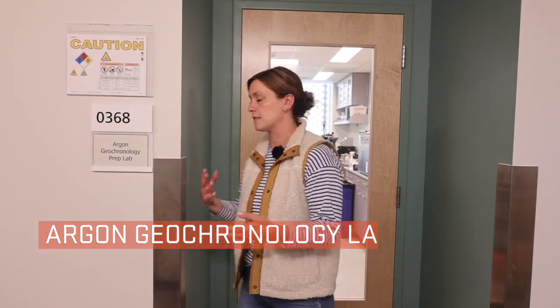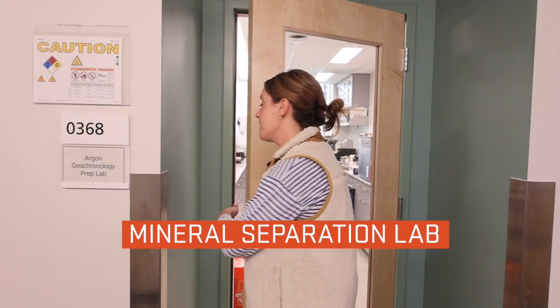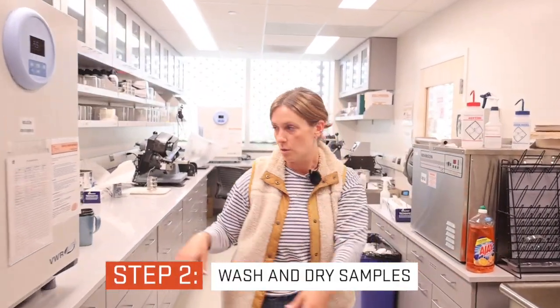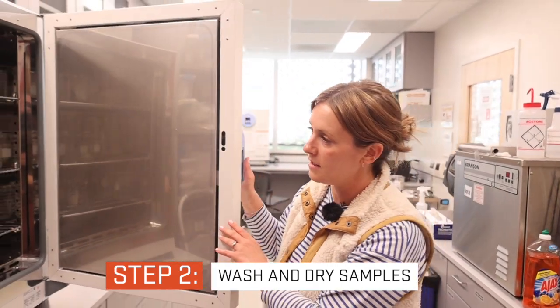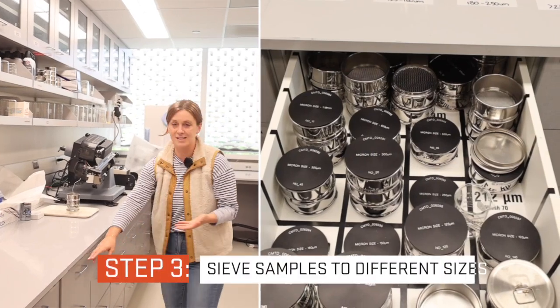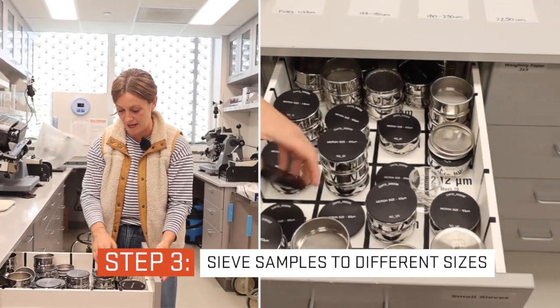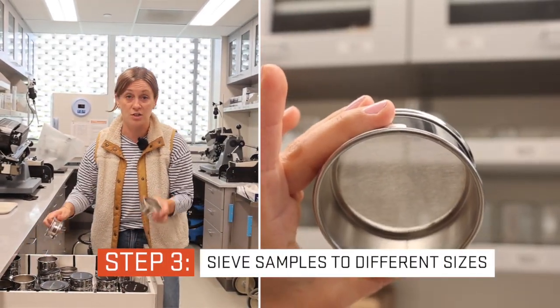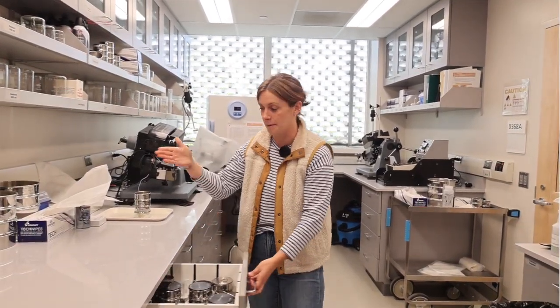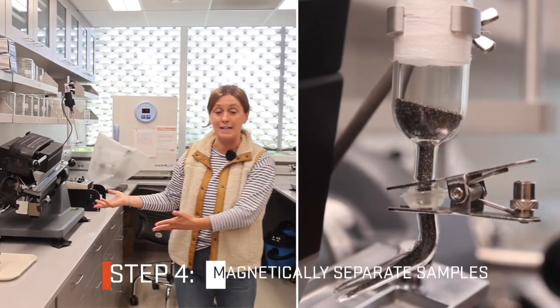The next thing we do is come up here to the mineral separation lab, and in this room, we wash our samples, we dry them in this little oven. We then sieve the samples, which is taking samples just into different sizes, from under 200 microns to like a couple millimeters. After we separated samples into different sizes, we magnetically separate.